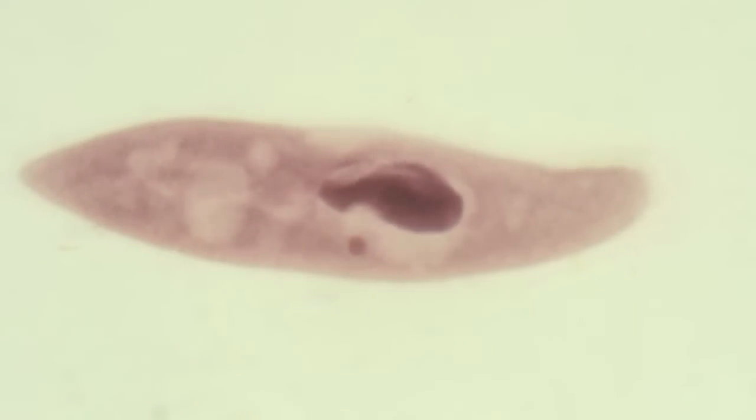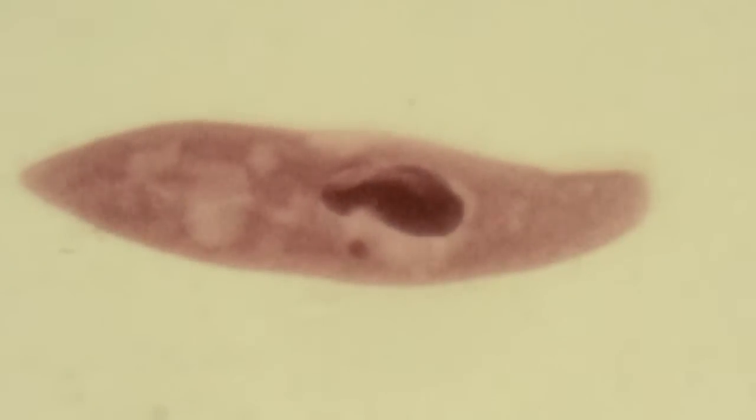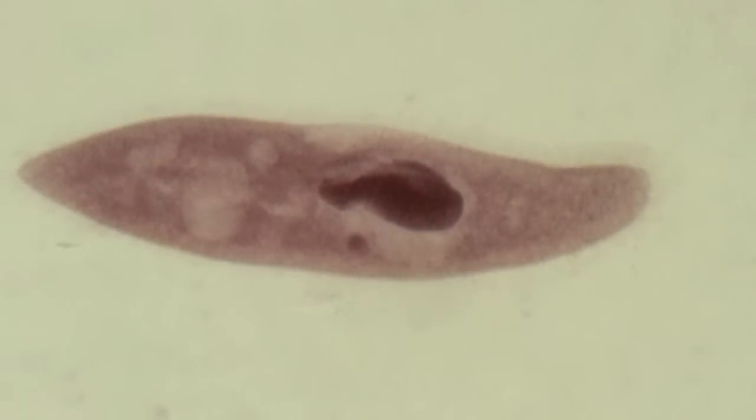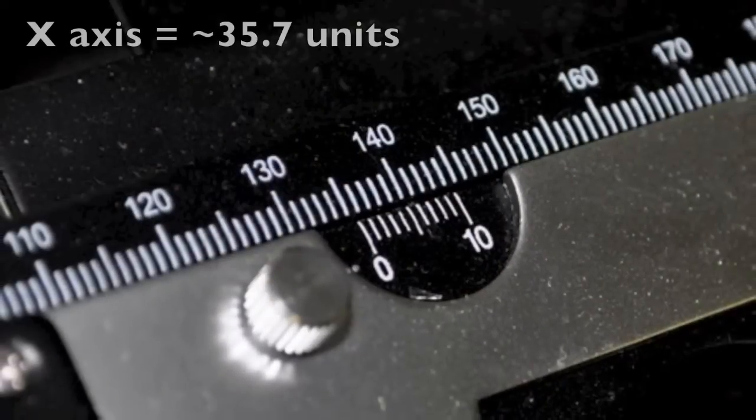Now we might actually want to adjust a little bit of the light parameters and see if we can sharpen or get a little bit better contrast inside of our specimen. We wouldn't want to move the substage condenser very much, but we can of course tweak the substage condenser iris in order to get a little bit more contrast. And we'll do that now. And then add a little bit of light with the rheostat. And there we get a little bit better clarity. We can see a lot more vacuoles now. We can see the nucleus, the nucleolus.